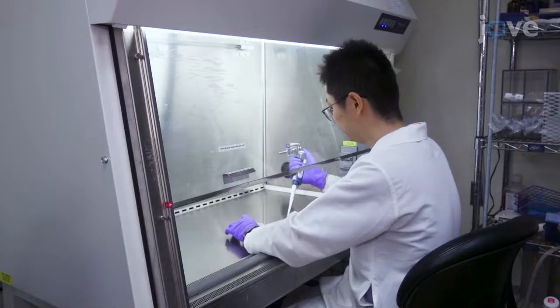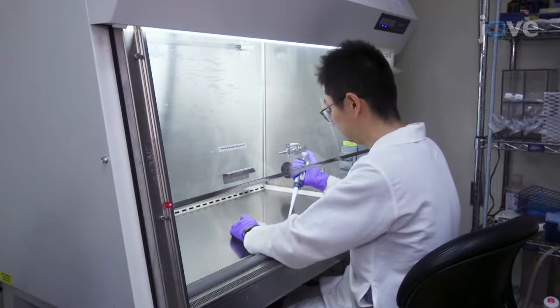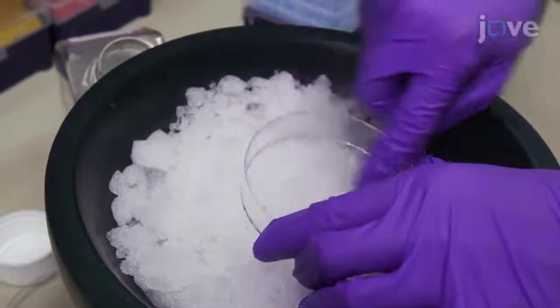In this study, we further enhanced the data analysis capabilities of the DARTs experiment by monitoring the changes in protein stability and estimating the affinity of protein-ligand interactions. The protein-ligand interactions can be plotted against two curves: a proteolytic curve and a dose-dependence curve. We've used the mTOR-rapamycin interaction as an exemplary case for the establishment of our protocol.